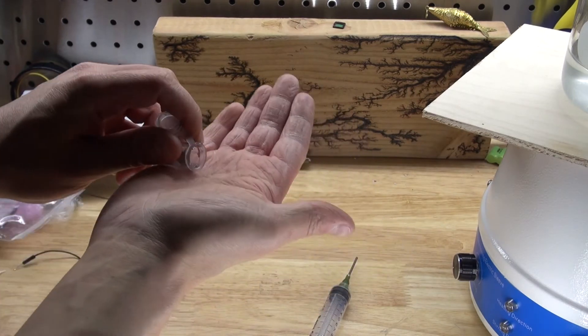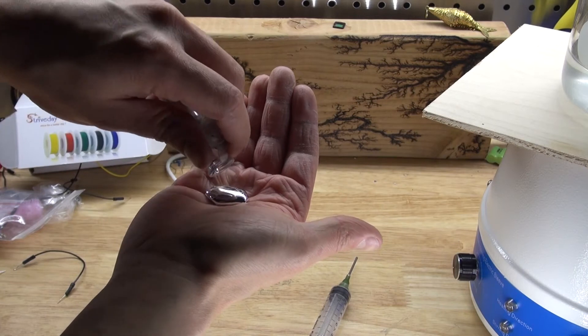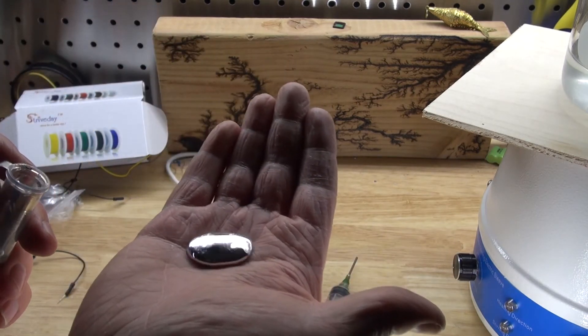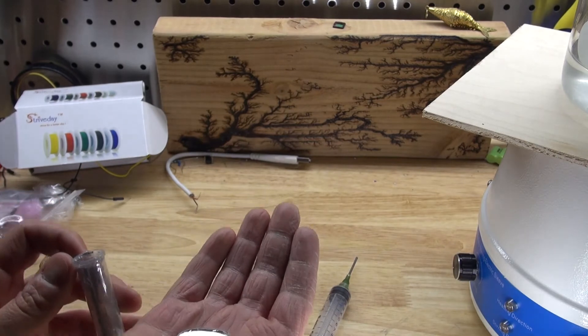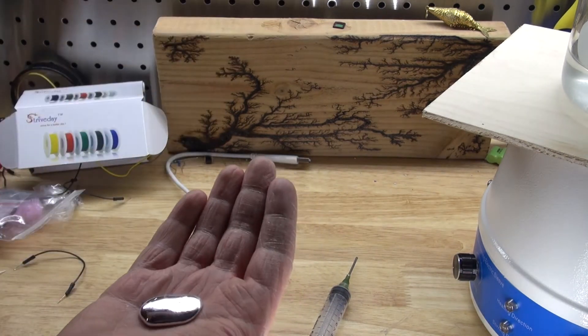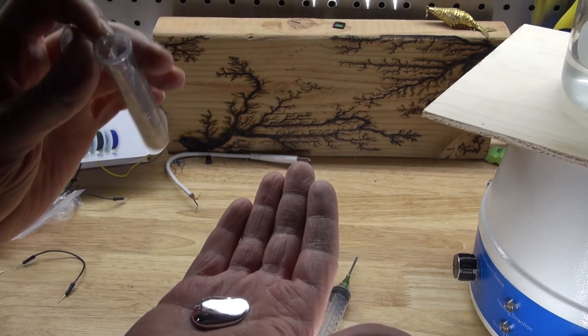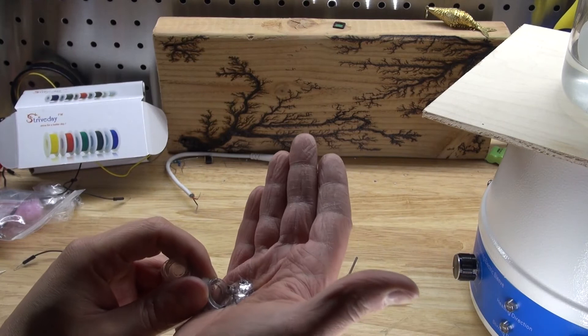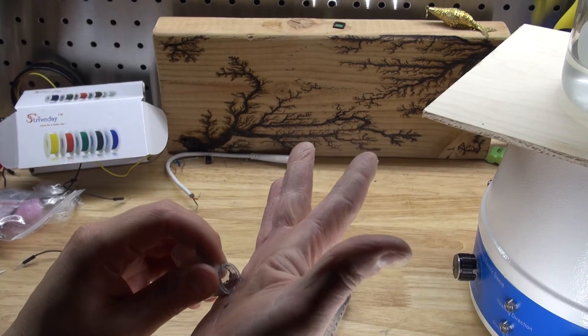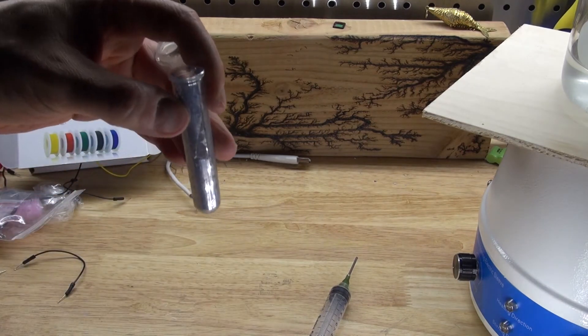Now as you can see, I have the liquid gallium right there. And to me, that looks pretty pure. There's still some water in here, so I'm going to dump it out. And just pour it back in. And there, I recovered my gallium.